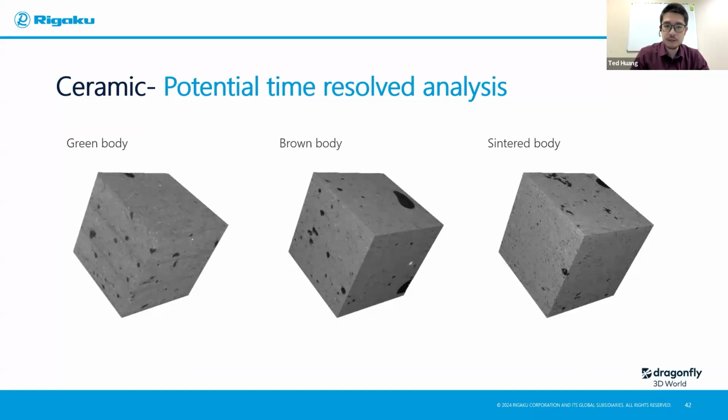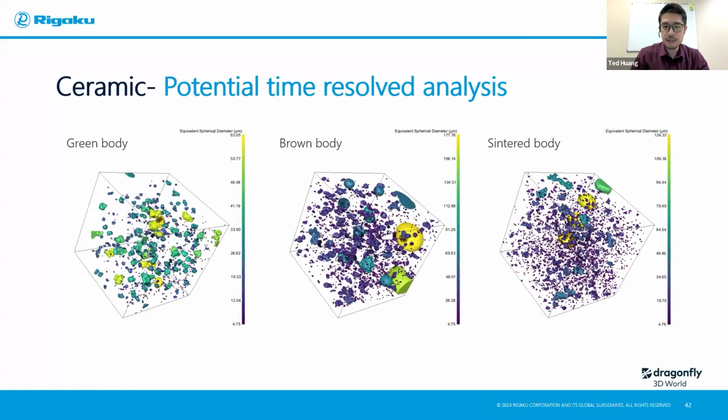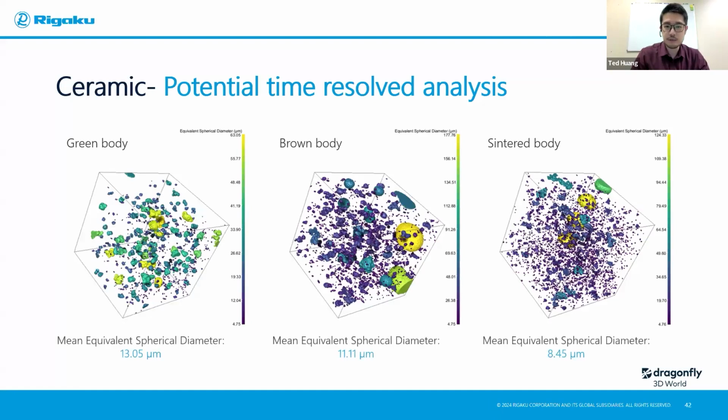You can see from the green body to the brown body and the final sintered body, the modeling, or the interfacial area, is not as severe or not as clear anymore. And obviously you can do the second phase analysis again with some more analysis information. In this case, I would like to know, oh, what's their equivalent spherical diameter, for example.